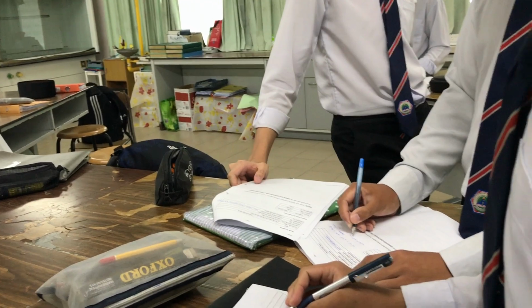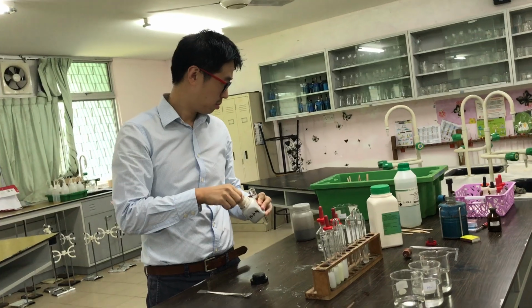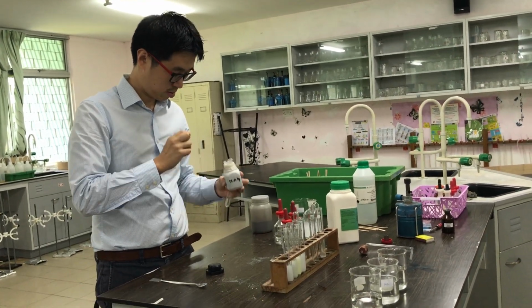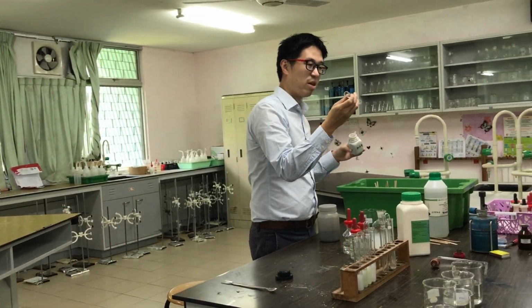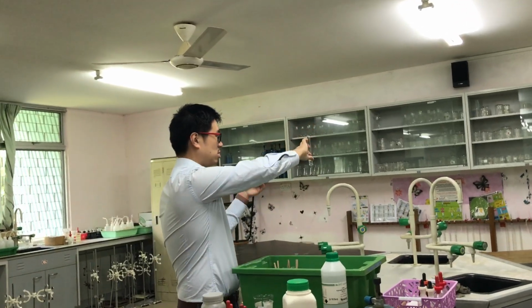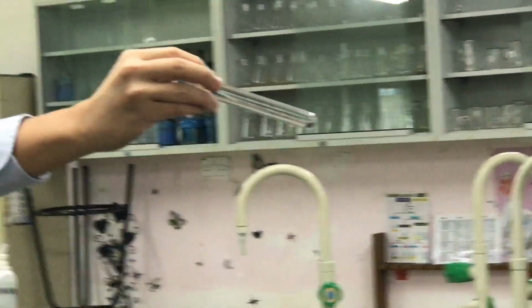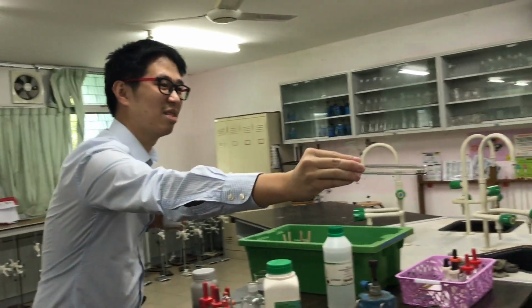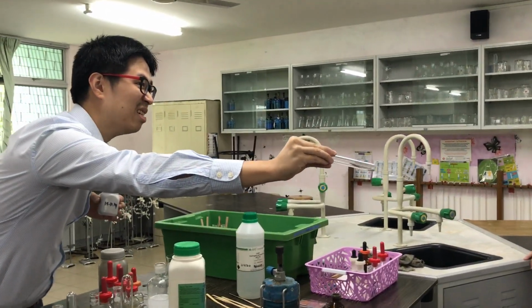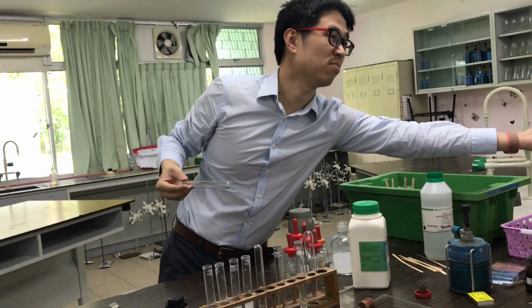Alright, when you're ready, come back here. So what I have is magnesium metal. This is the empty test tube. So I'm just going to put some magnesium powder into it. So that's the color of magnesium. What color do you see? Black. It's kind of gray, yeah? It's solid, do you agree? Metal is solid, okay? Pass it around. The metal is magnesium.